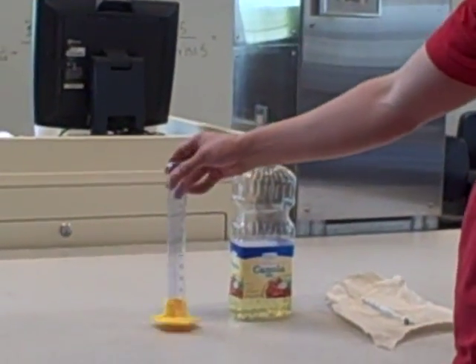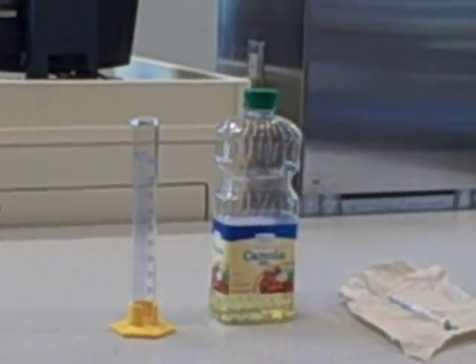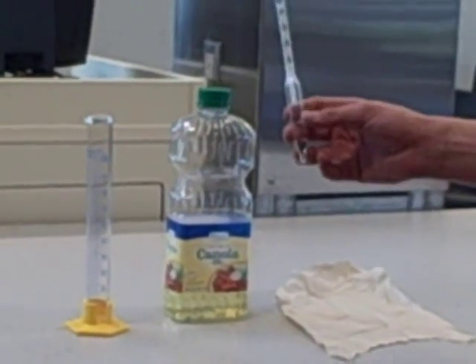The tools you will need are a graduated cylinder and an API gravity hydrometer.